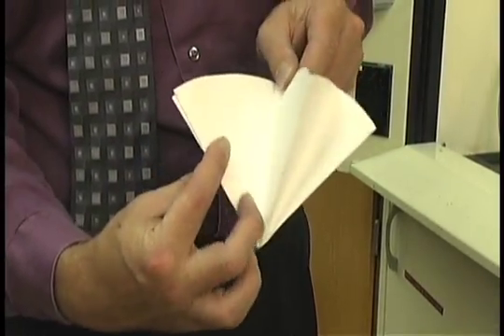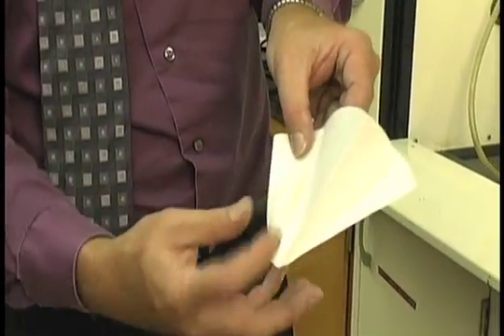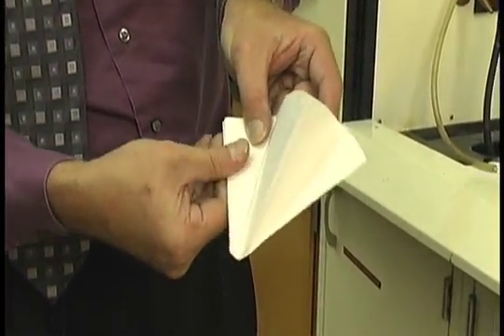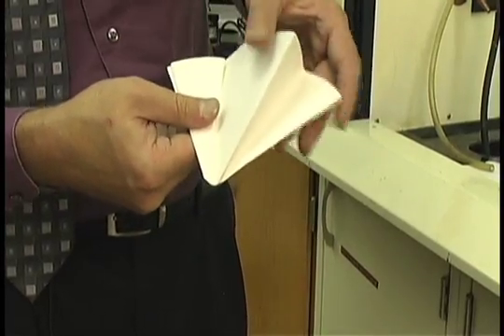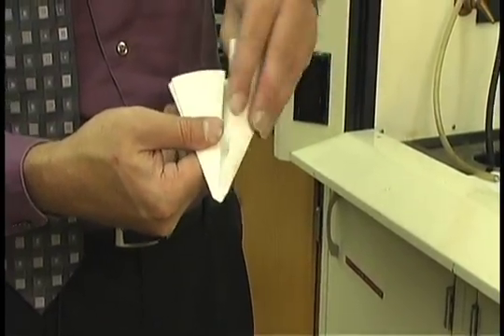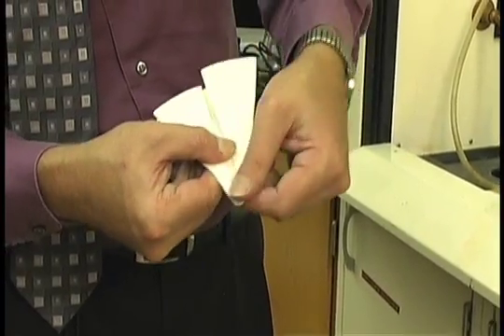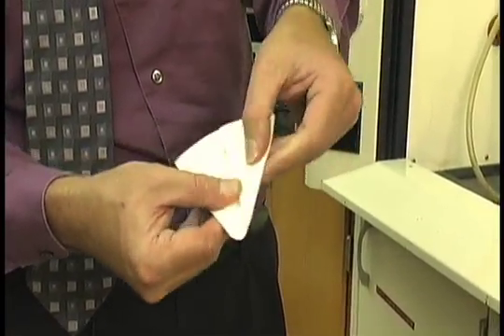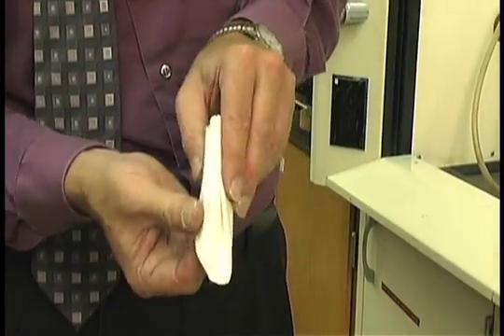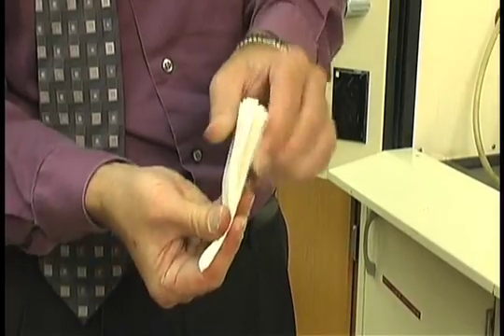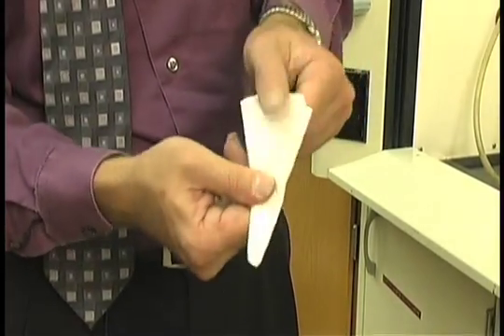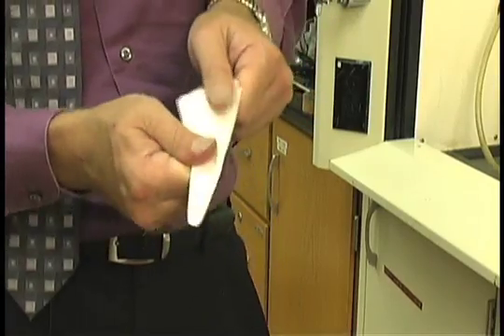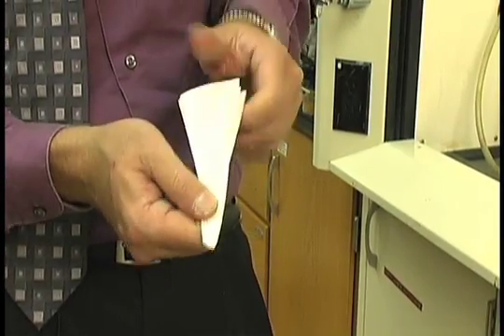Fold this edge in and then fold it towards the center. Same thing. Fold it towards the center and then fold it back and then crease all the edges.